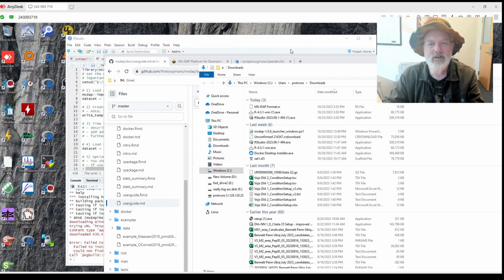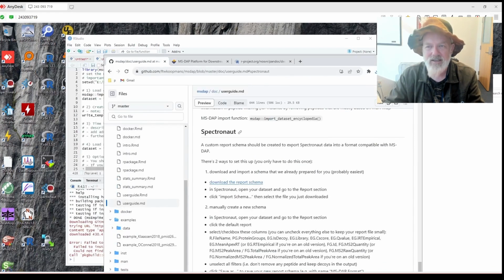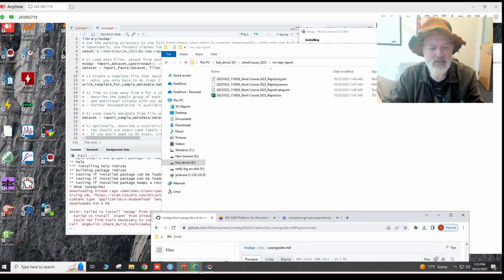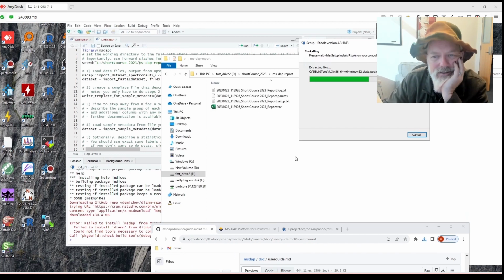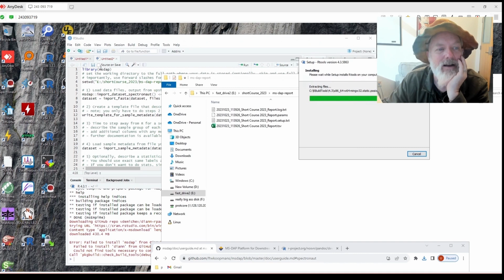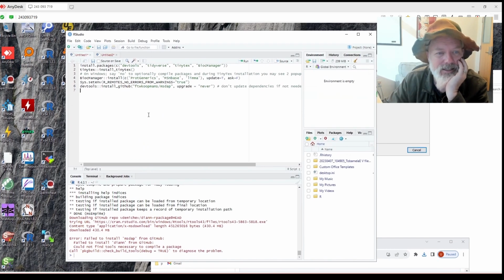Okay, I know this is very boring. So let's close that and see if RTools is done yet. Oh my gosh, this takes forever. After this is installed, we should be all set. But anyway, I wanted to do this with you because I run into so many problems with RStudio, and I kind of just have to hack through it till it's all installed.